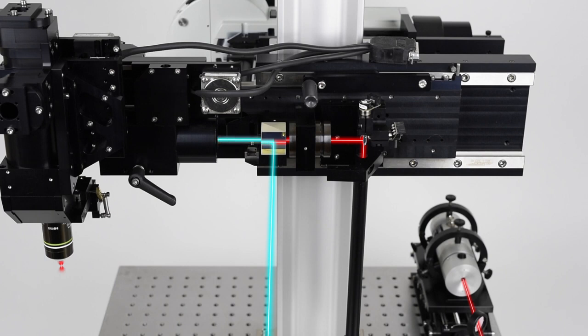A second set of galvo scanners and a scan lens can even be added to control the scanning of this beam to perform site-specific stimulation from a secondary laser. This is particularly useful when a stimulation beam needs to be limited to customizable regions of interest within the field of view, independently of the imaging scanner system.